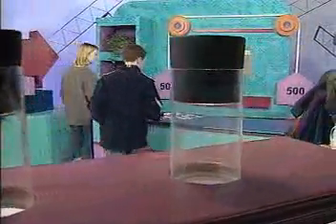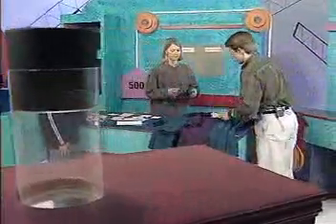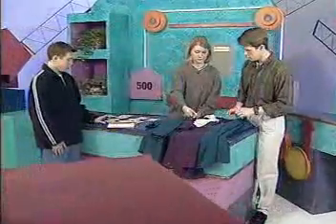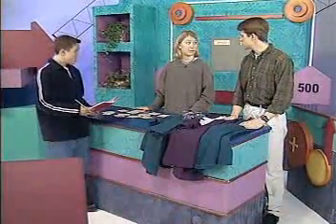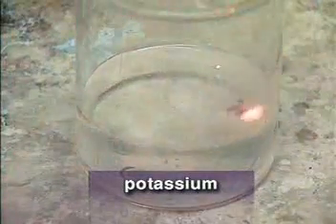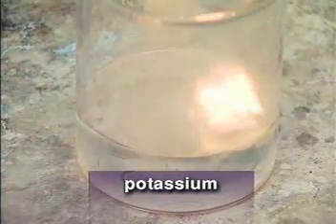Okay, so based on what we've observed, are there similarities in the reactions that help us group these elements? Well, all the metals we tested react with water. They all gave off gas bubbles. Potassium had the most violent reaction. Yeah, it actually looked like it was on fire.